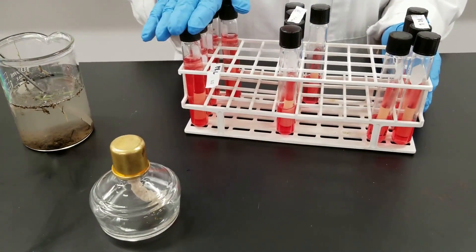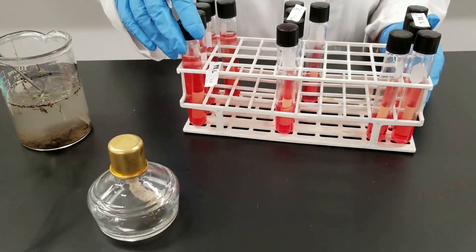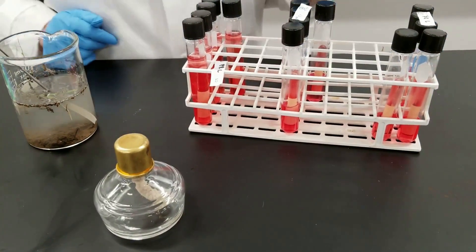So this is a double strength phenol red with lactose, and in these I put 10 milliliters of water. In this middle section here we have, once again, the phenol red with the lactose.